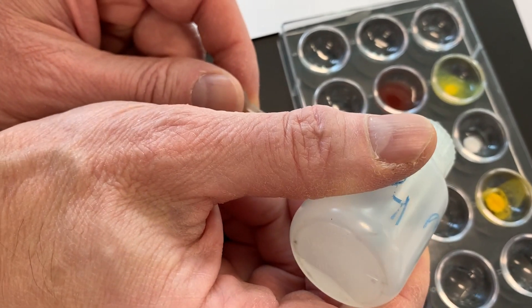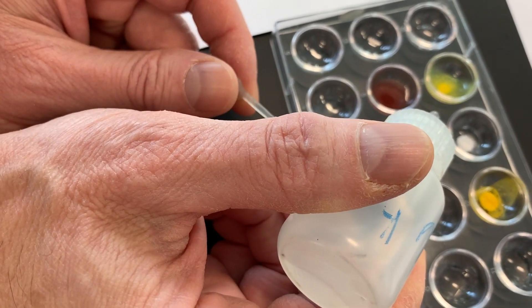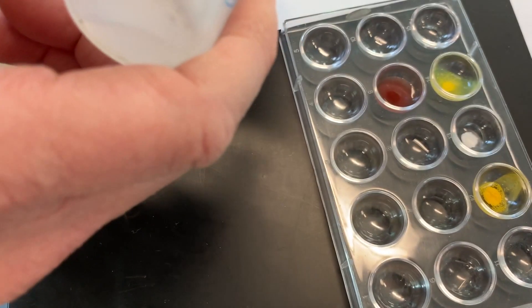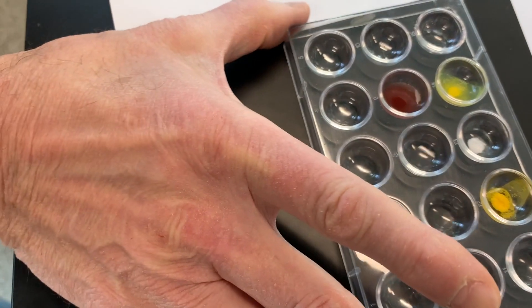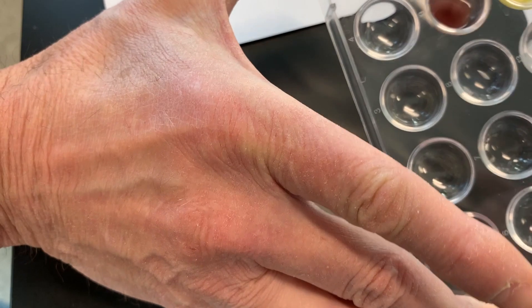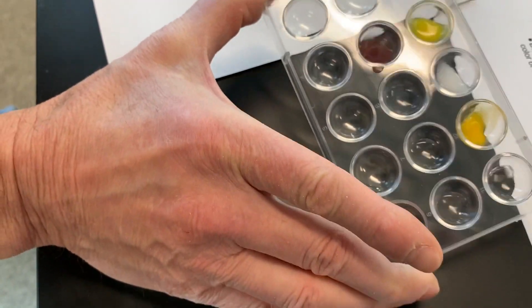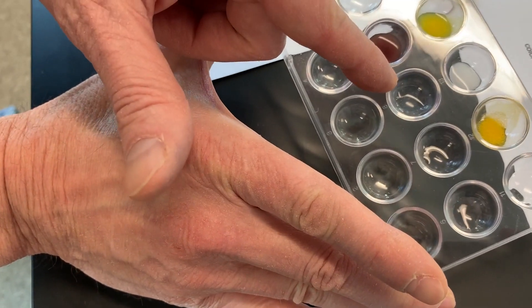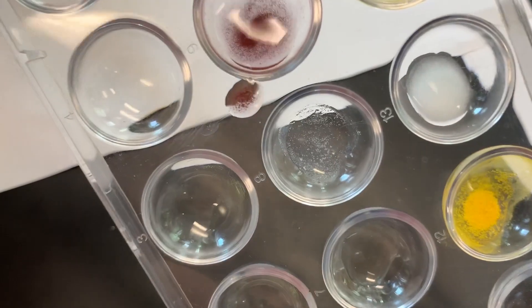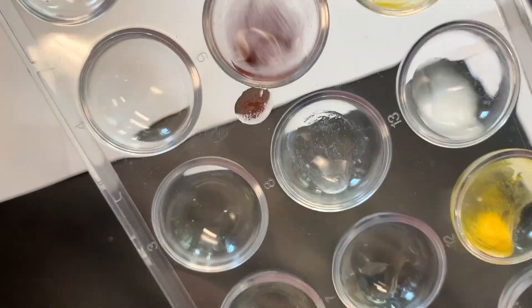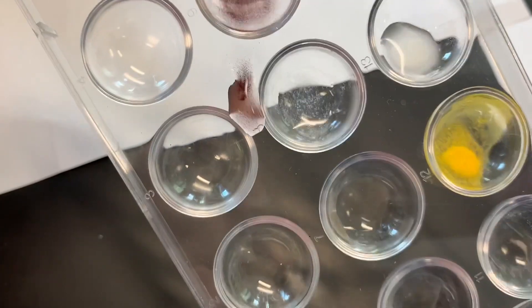Now one drop of the magnesium sulfate to go with the concentrated silver nitrate. See, it's getting a little foggy. Can you see that there? Something's forming. Yes, now I see. Looks like a teeny tiny piece of rice.